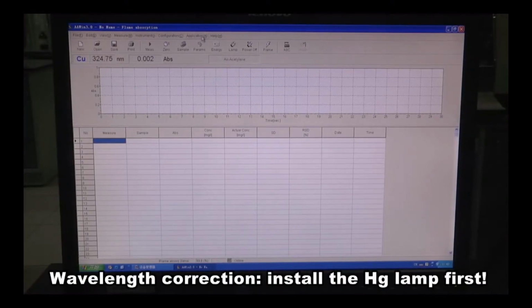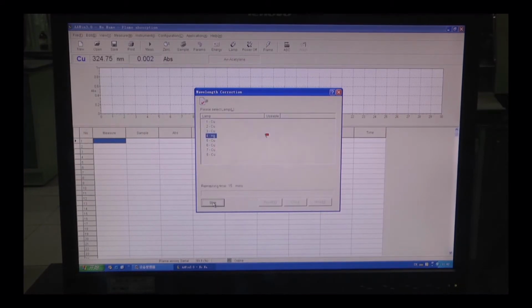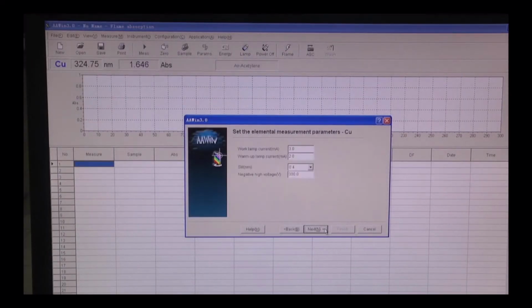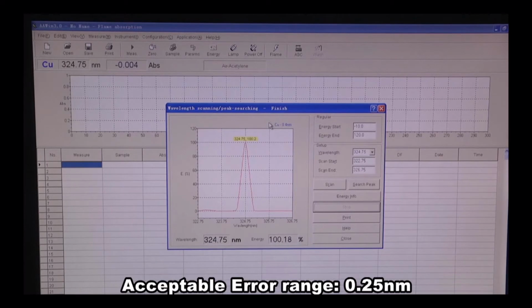To do wavelength correction, make sure the mercury lamp is in the lamp turret. Then here we press Application and choose Wavelength Correction. The system will automatically recognize the mercury lamp. We just press Start. This process takes 15 minutes to finish. When the wavelength correction is finished, it will show complete. Then we go back to lamp to search peak again. This time, the peak is at 324.75 nanometers. It's exactly the standard value. Hence, it is within 0.25 deviation.